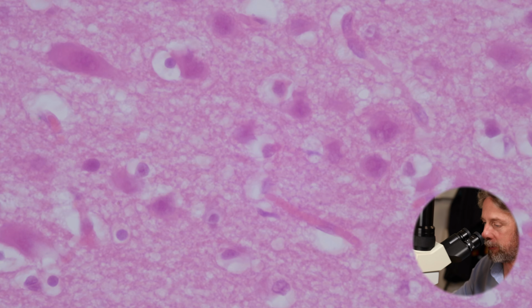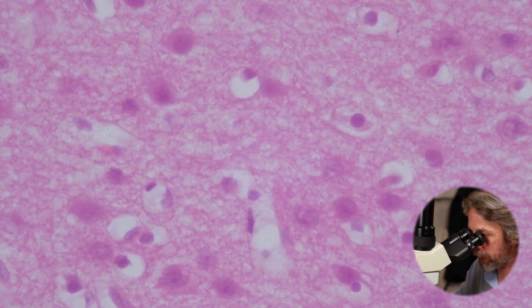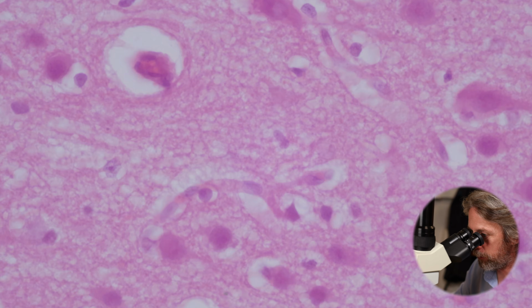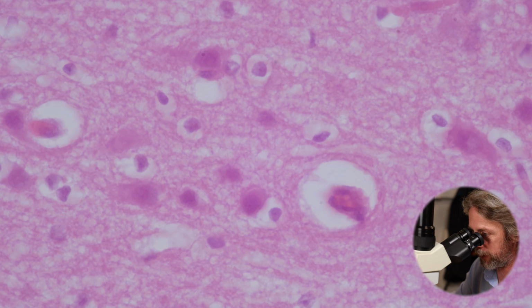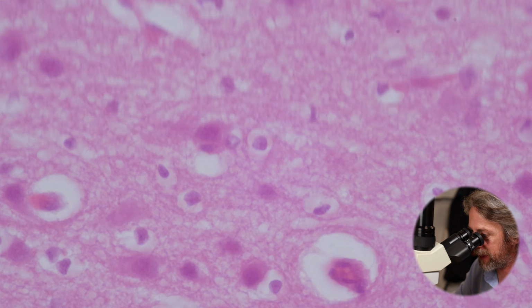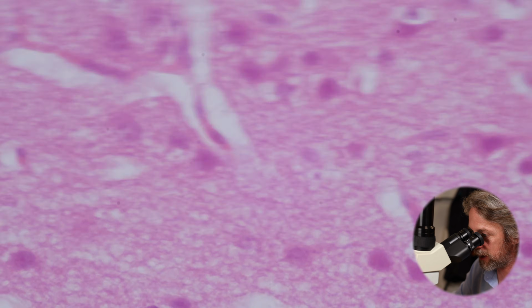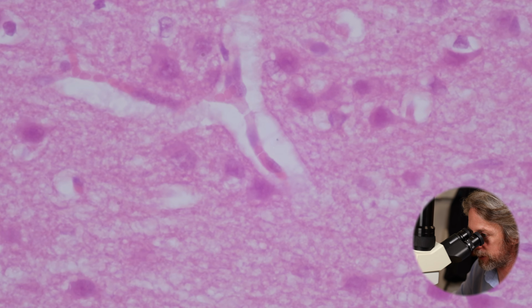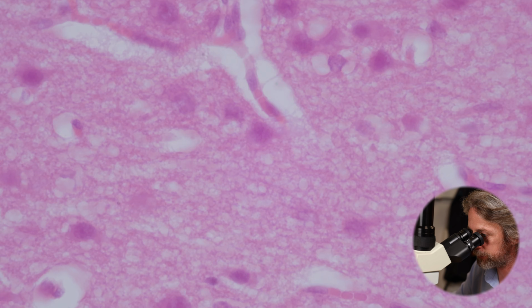Of course, you've got that blood-brain barrier separating the blood from the brain, but there are capillary beds throughout the grey matter. There are capillary beds throughout the brain. That's how the brain is getting all that glucose that it uses. It's very, very well vascularized. That's what we're seeing with a lot of these little wiggly shapes in here.